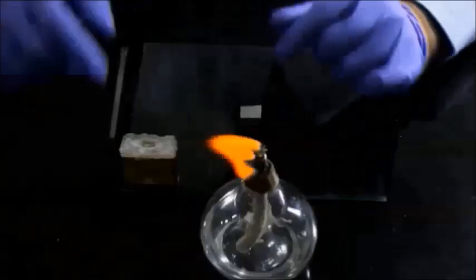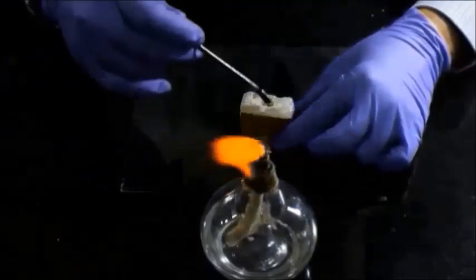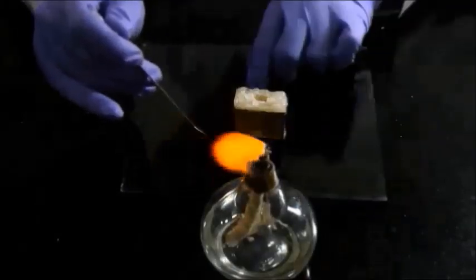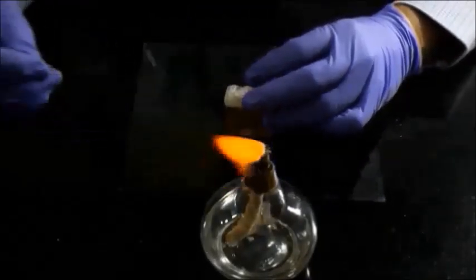The trimmed block is then fixed on the block holder. The front side of the block holder is covered with a thick layer of wax in which the block is fixed by melting the central part of the wax, and cementing with molten wax is carried out for tightening of the block.